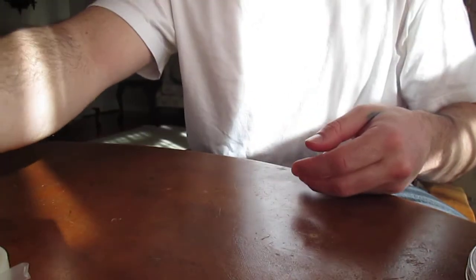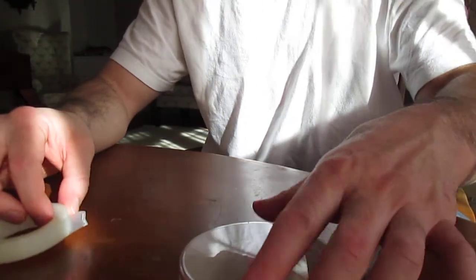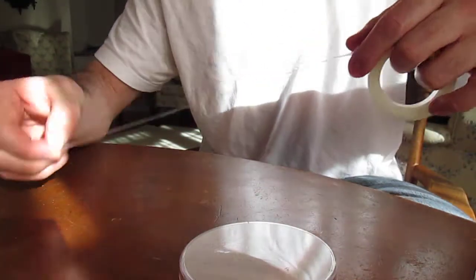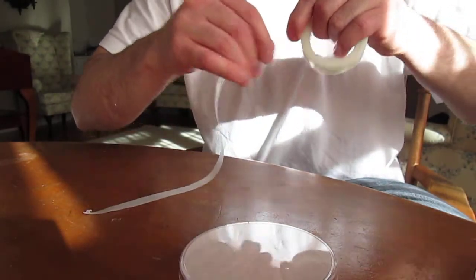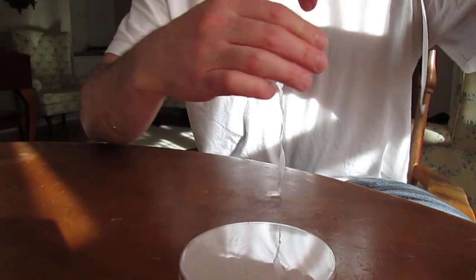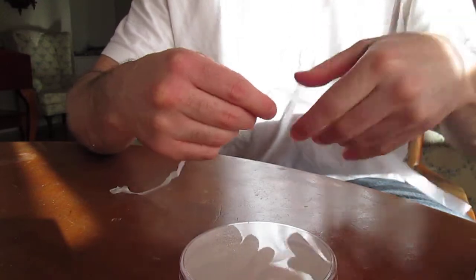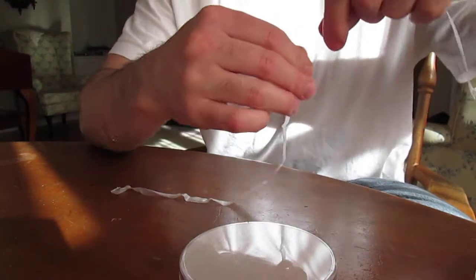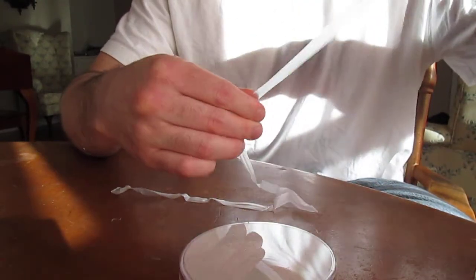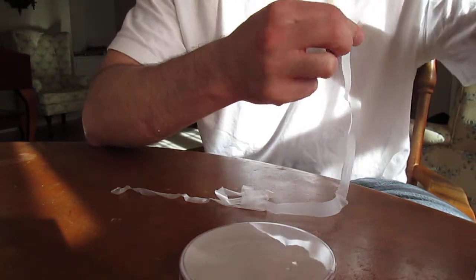That's one—you can see it's nice and tight. Now, I just finished pouring the agar into these dishes, so in order to find out whether or not they're completely sterile, what I'm going to do is leave them out of the refrigerator for a few days, probably about three days.